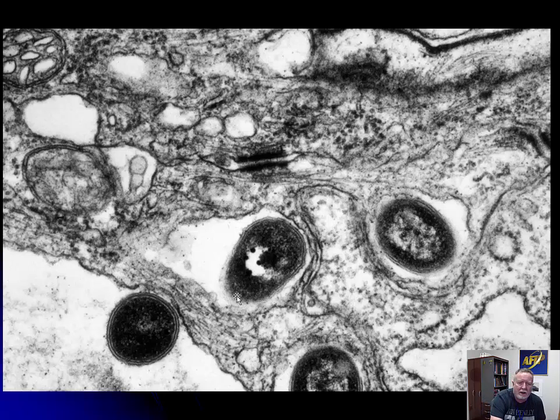This is a picture from a fathead minnow that has a mycobacterial granuloma. We look at the bacteria here, and they're not very interesting. Bacteria are sort of boring on EM, but we're going to spend a lot of time talking about them later on in the lecture series. And here are some very nice desmosomes. These aren't cut very well up here, but it helps the body wall off those bacteria.